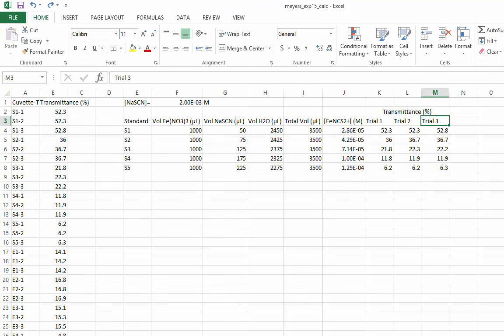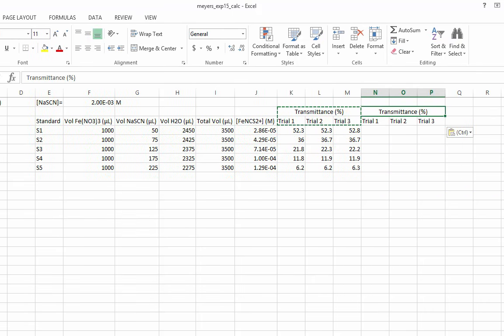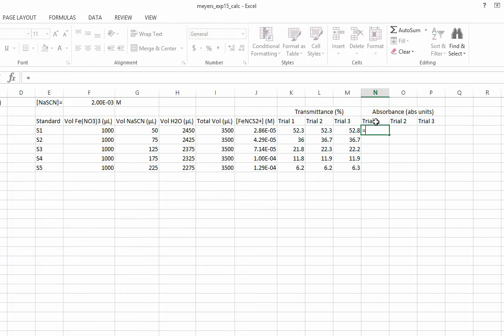I mentioned that Excel can perform many functions. In order to calculate the absorbance, we'll use the log function. Absorbance equals 2 minus the log of the percent transmittance.